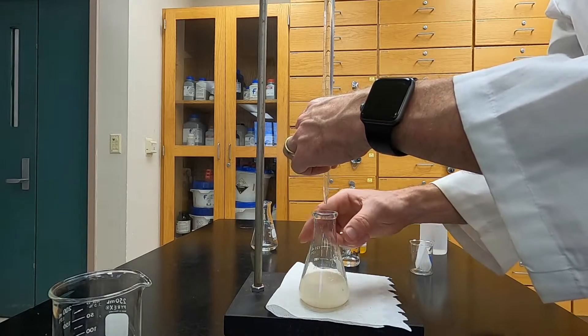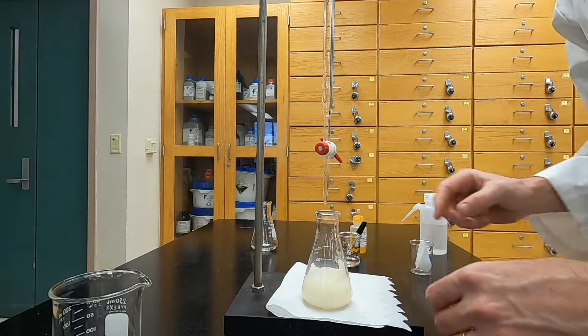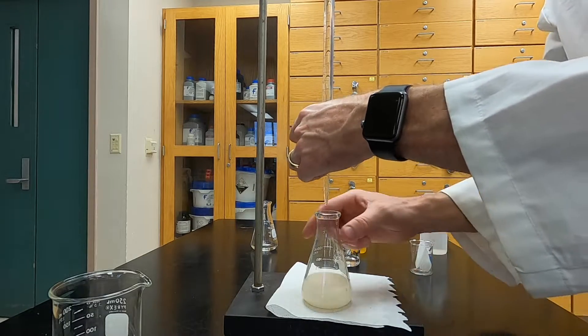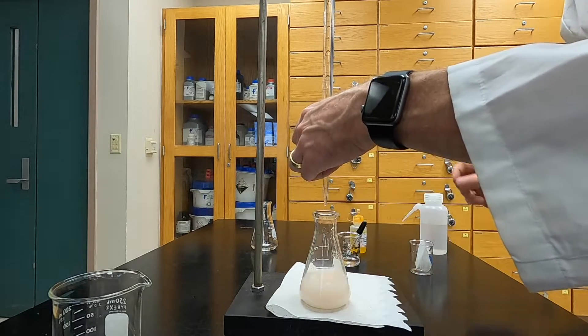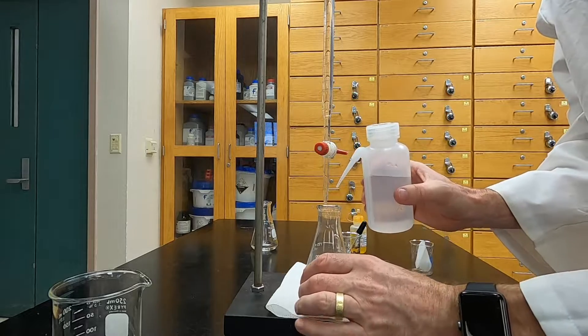As I mentioned earlier, the color you're looking to achieve is a faint pink color throughout the solution. We don't want it to be a dark pink like Pepto-Bismol, but just a faint pink color like you can see here.